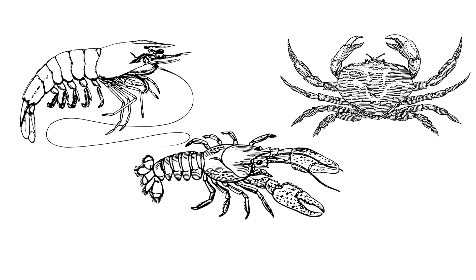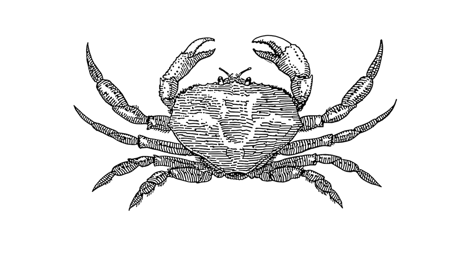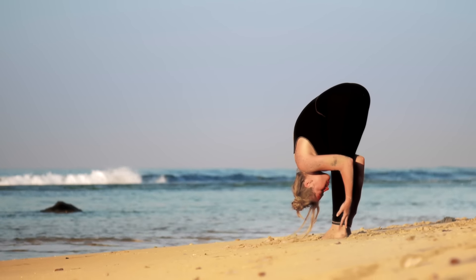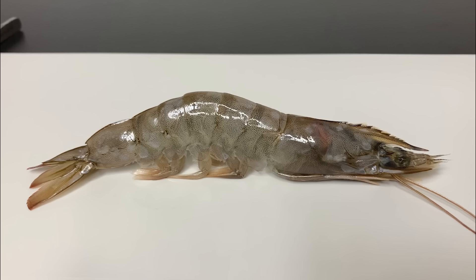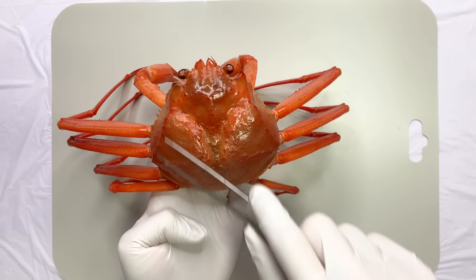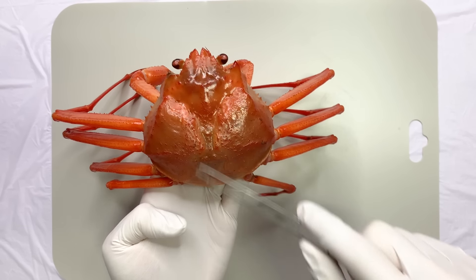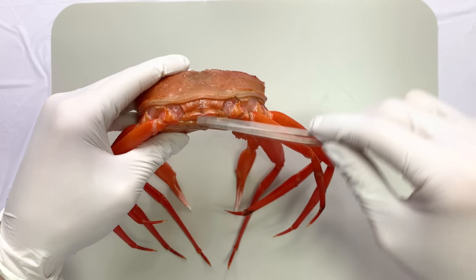However, crabs have a distinct appearance compared to shrimp and lobsters. The reason is that crabs have a body folded in half. The bodies of decapods are divided into the cephalothorax and abdomen. This carapace part is the cephalothorax, while the abdomen is folded underneath.